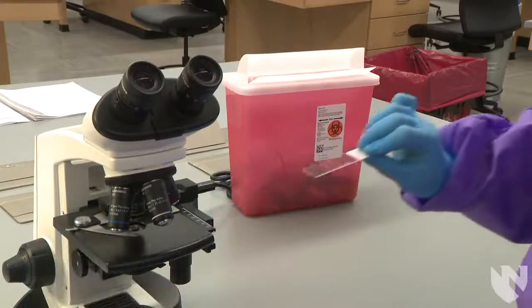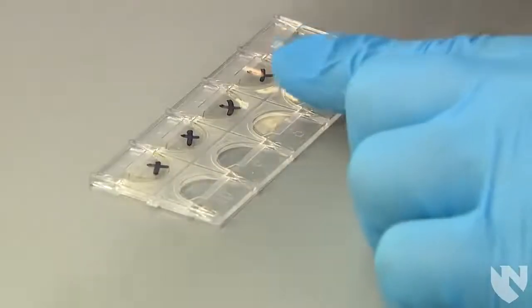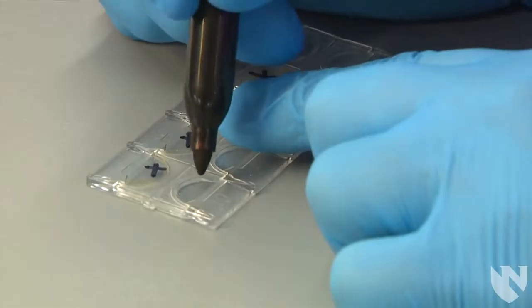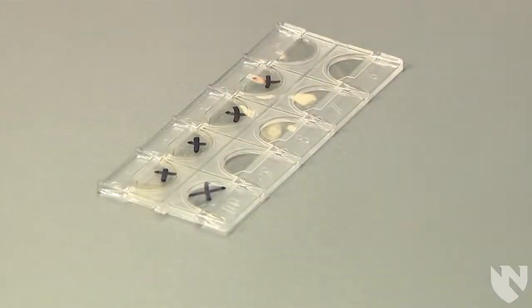Once you have completed the microscopic, dispose of the wet prep slides in a sharps container, or if you are using a Kova slide, use a sharpie to cross out the well you just used with a slash mark or an X.